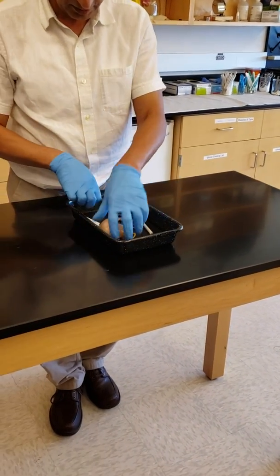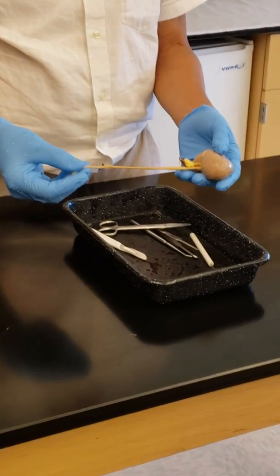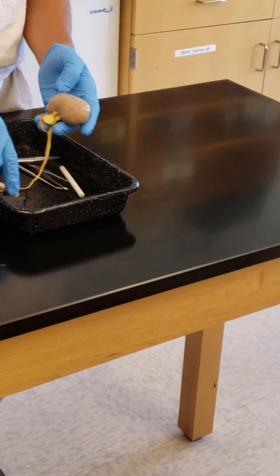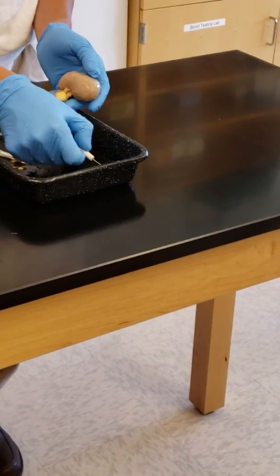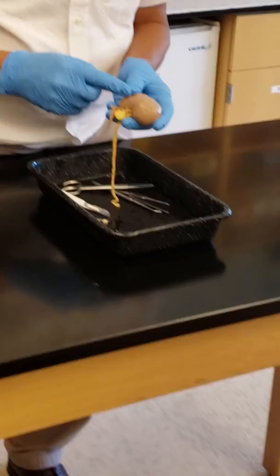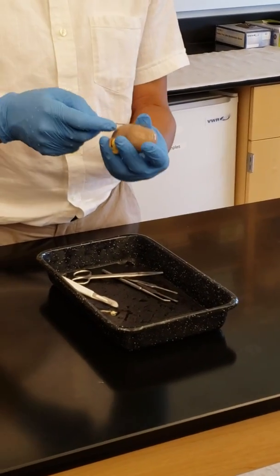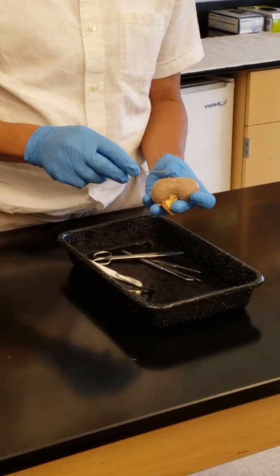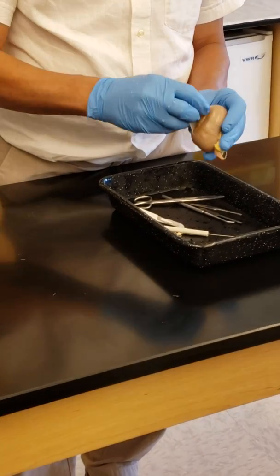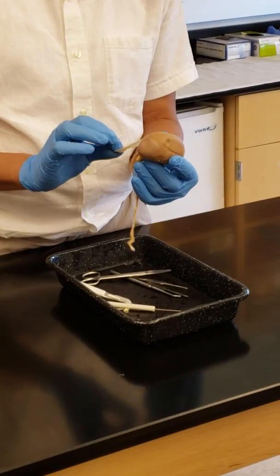You can see this in the animal kidney. You can see the ureter, right? Ureter now. You can see this side is the hilus. And to see the capsule, this is the membrane capsule here, see? Right, capsule. And if I cut this capsule, is the capsule here, right? Okay.